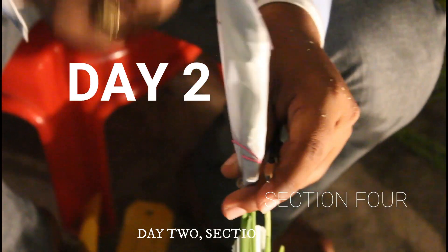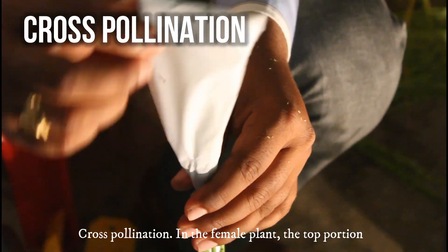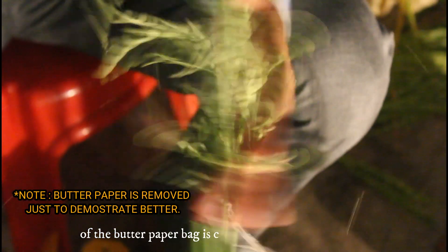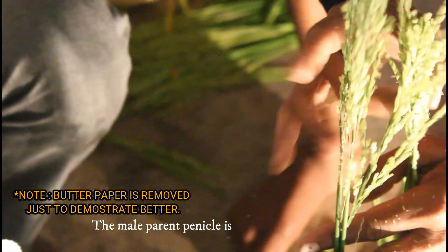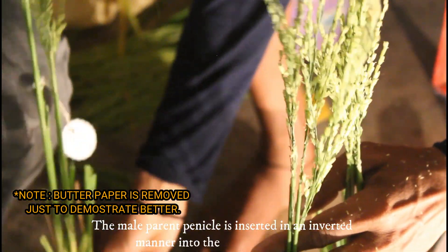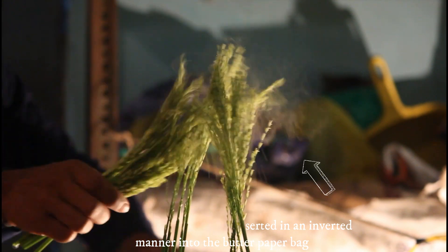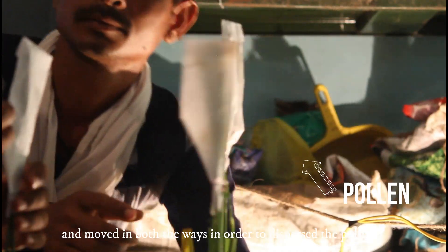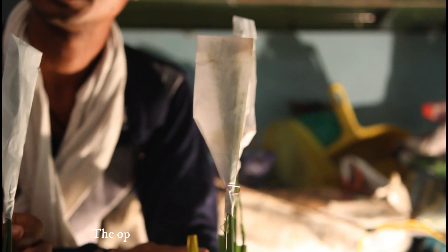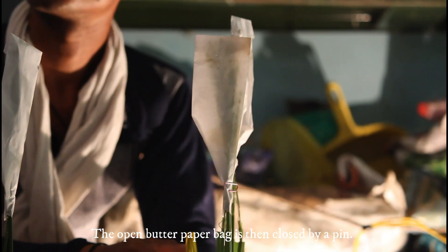Day 2, Section 4: Cross-Pollination. In the female plant, the top portion of the butter paper bag is cut off to expose the panicle. The male parent panicle is inserted in an inverted manner into the butter paper bag and moved in both directions in order to disperse the pollen. The open butter paper bag is then closed using a pin.